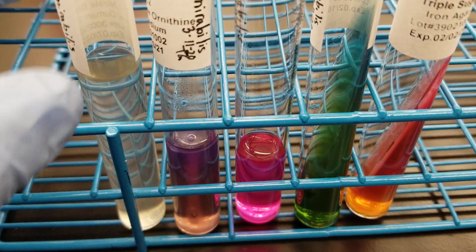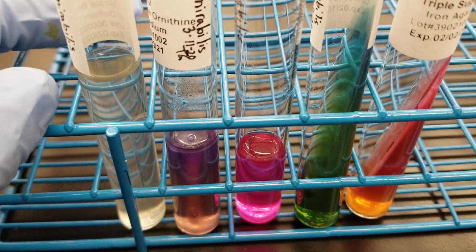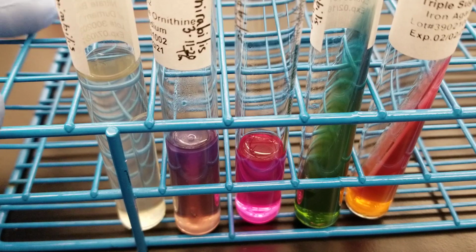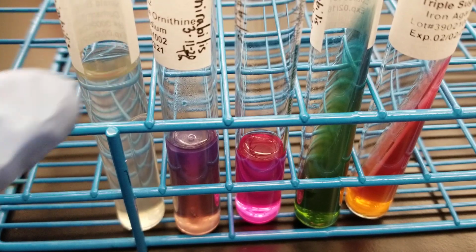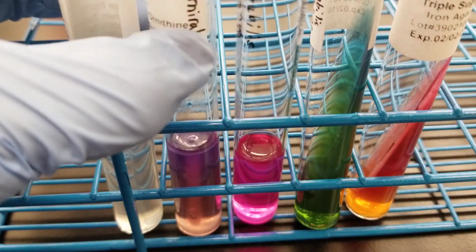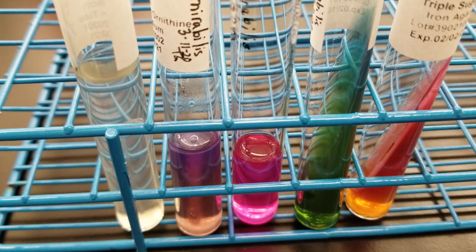It is a swarmer, okay? So you would see really nothing on the plate until you draw a line. We've done a video on that before, and it's just swarming all over the plate, so it looks like there's nothing on the plate but a sheen, and then you put a line through and you're like, oh, that's all bacterial growth, and it can be in waves. So let's do the indole for this and see what we get.